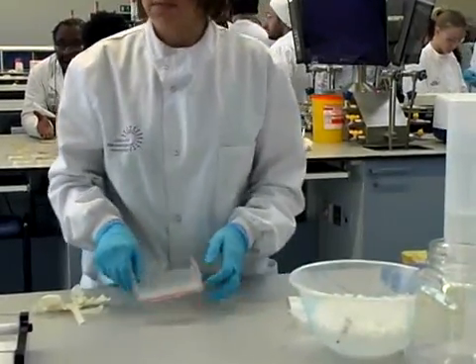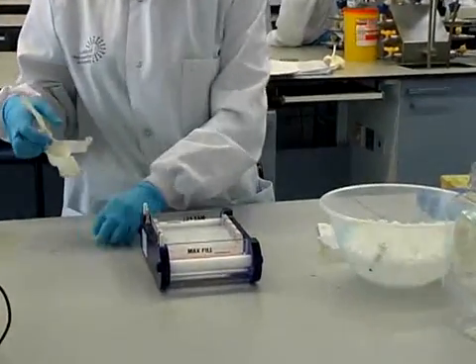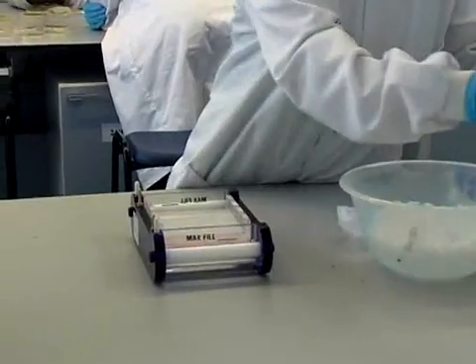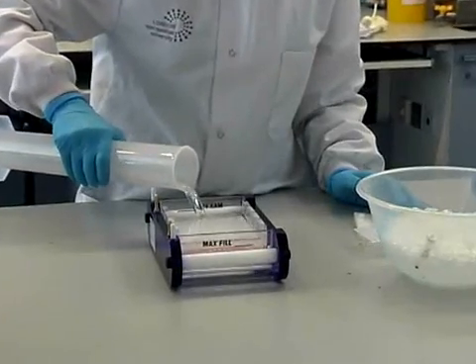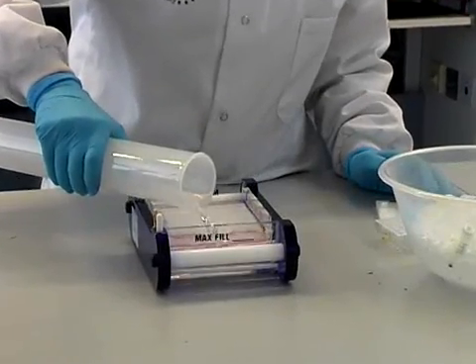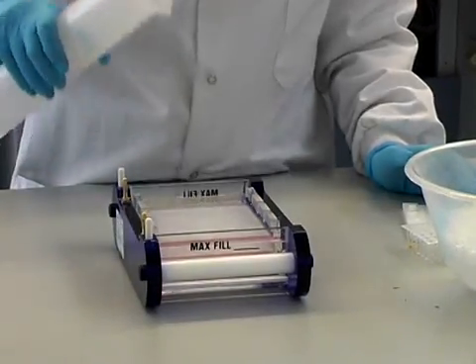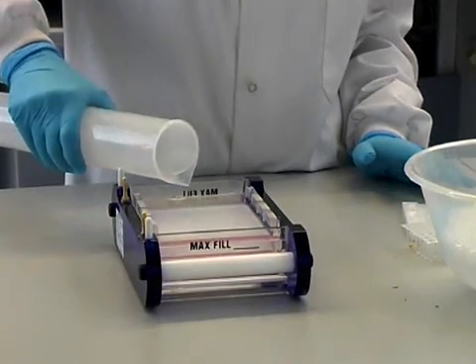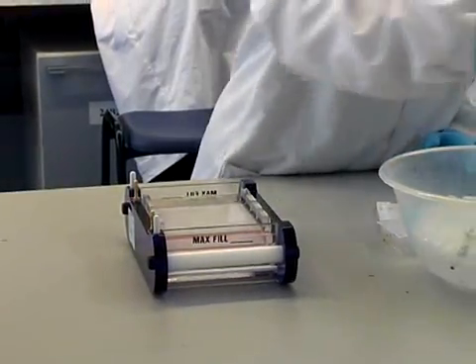The comb is removed leaving the sample wells and the gel is placed in the electrophoresis tank. Now 300ml of Tris Borate EDTA buffer is poured into the tank to cover the gel. To the buffer Ethidium Bromide has been added and the buffer is added to the maximum fill line on the electrophoresis tank.